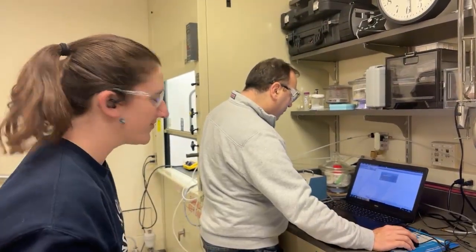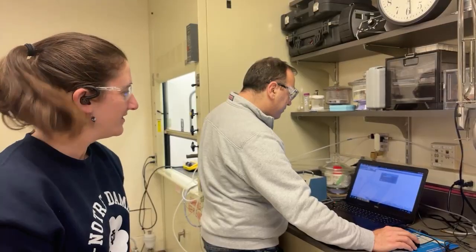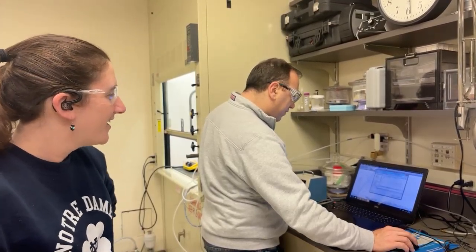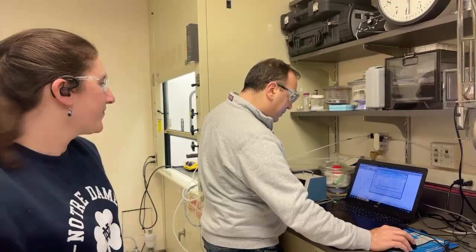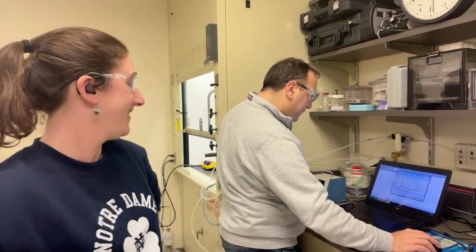Okay, so now we can save this data. Cool, thanks. Can you send that to me too? I'm really excited to have the data. I love data. I get to look at spectra too, but they don't look at all like this.